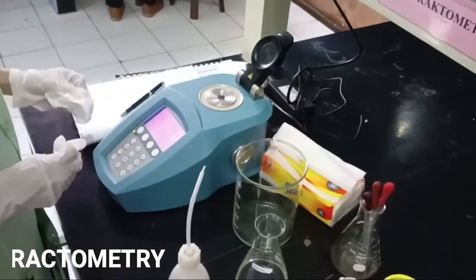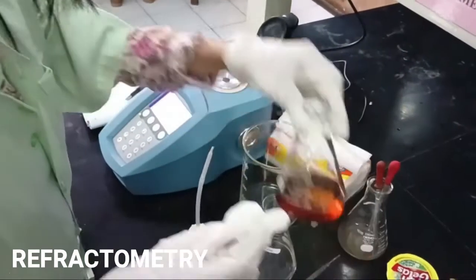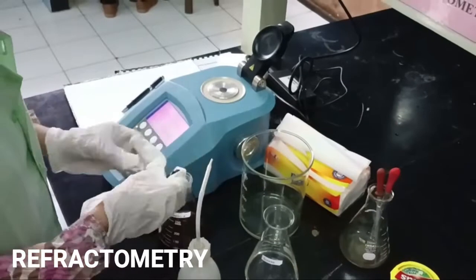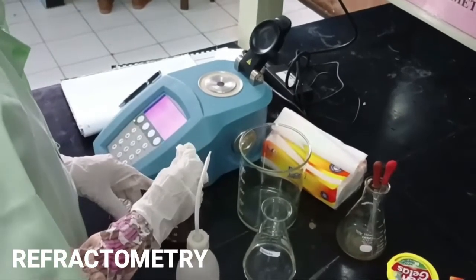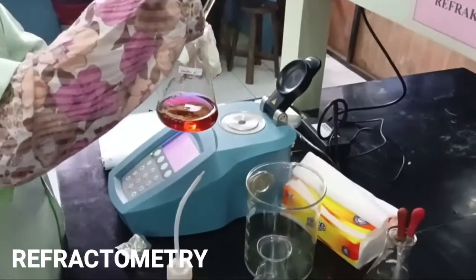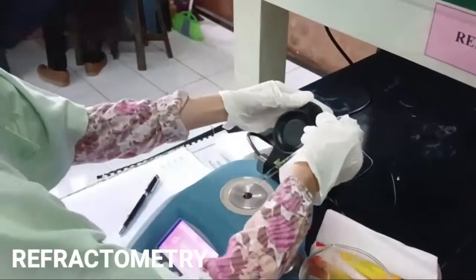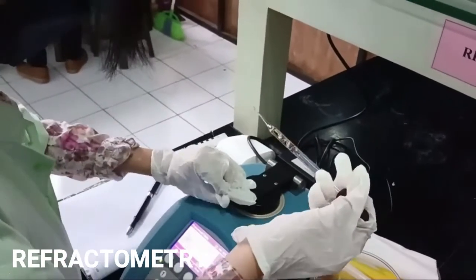In the refractometry experiment, students are expected to be skilled in using a refractometer to analyze organic compounds qualitatively by determining the refractive index of a compound. This experiment supports courses in organic chemistry, food analysis chemistry, food chemistry, instrumental chemistry, and so on.